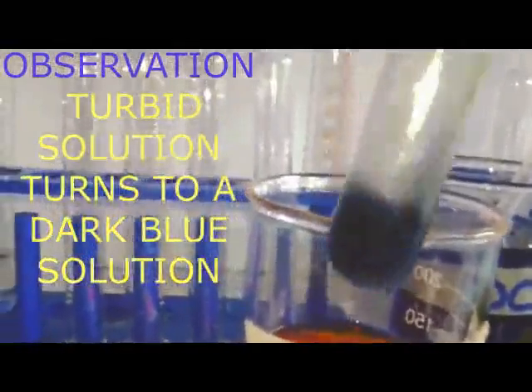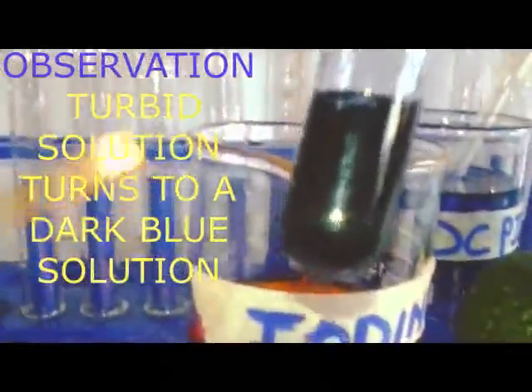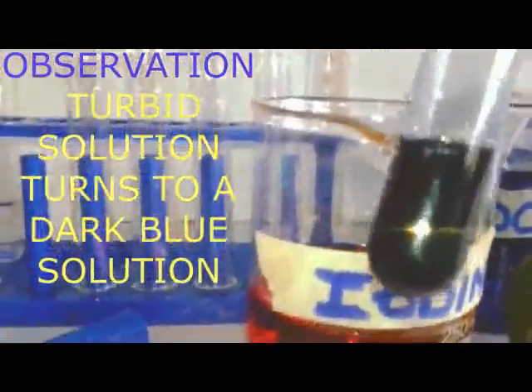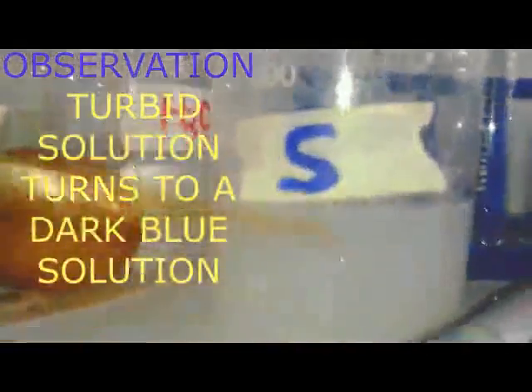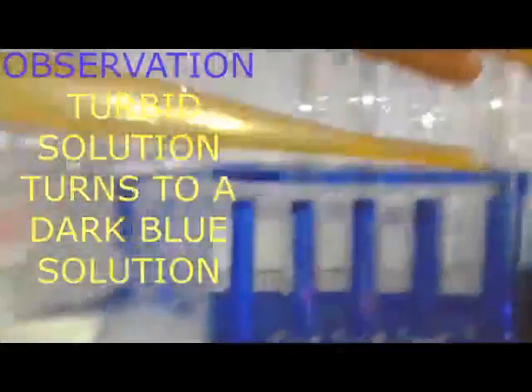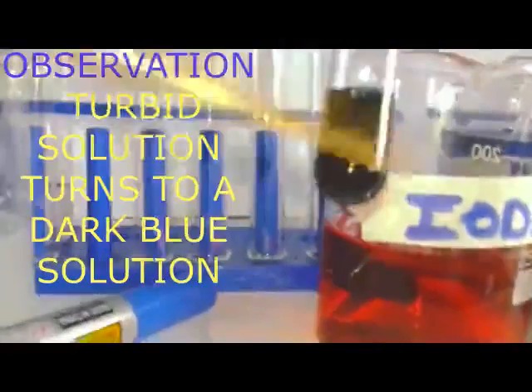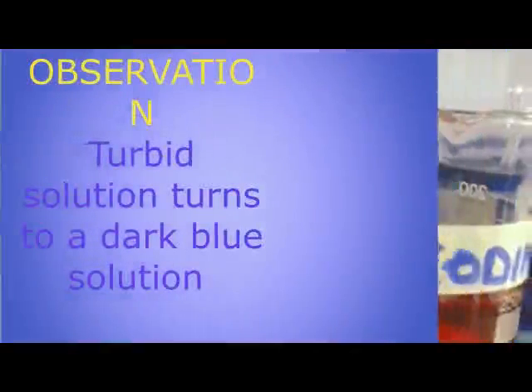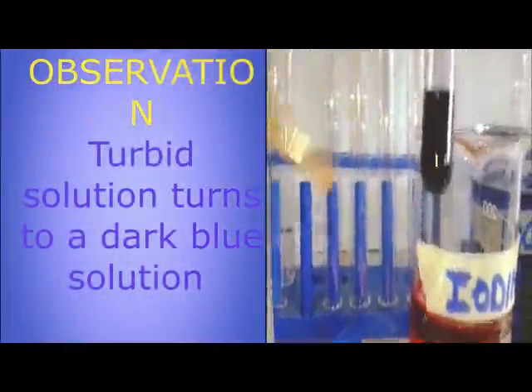Even if you add excess, you can see this one is going to become a black solution, or you can even say a darker blue solution. And our observation is going to be: turbid solution turns to a darker blue solution. And then our conclusion will be starch present.